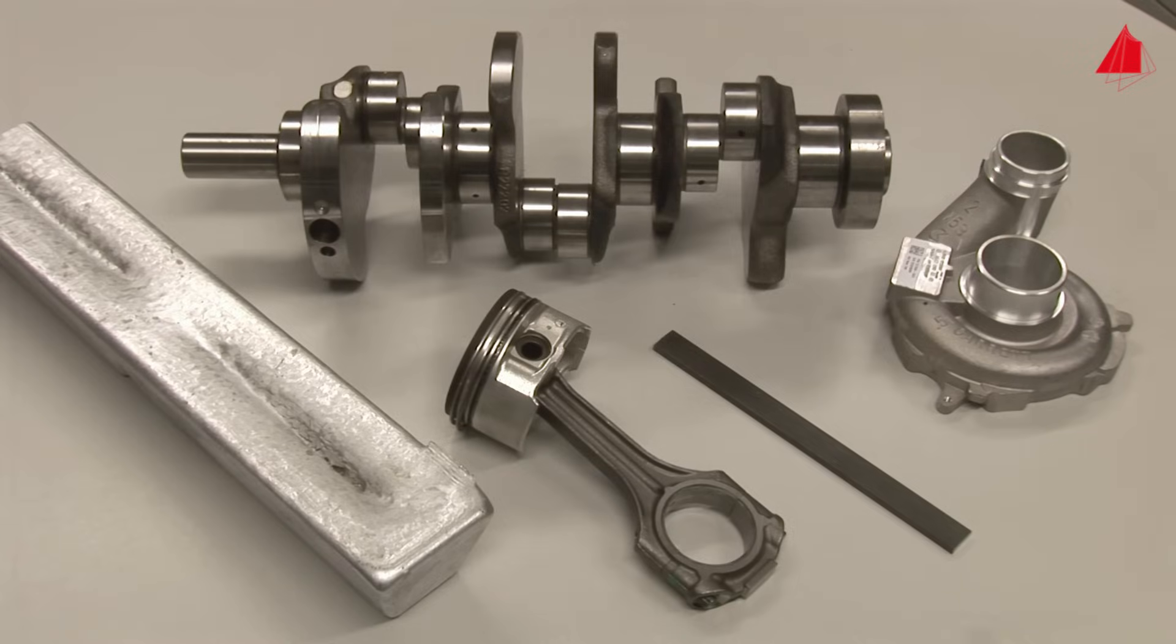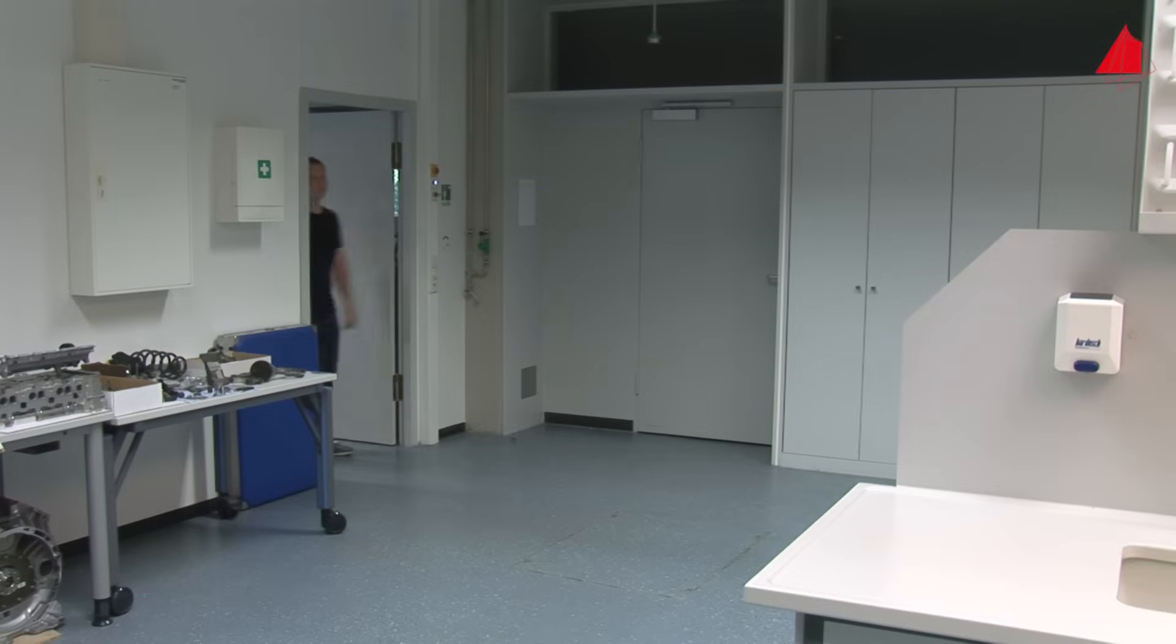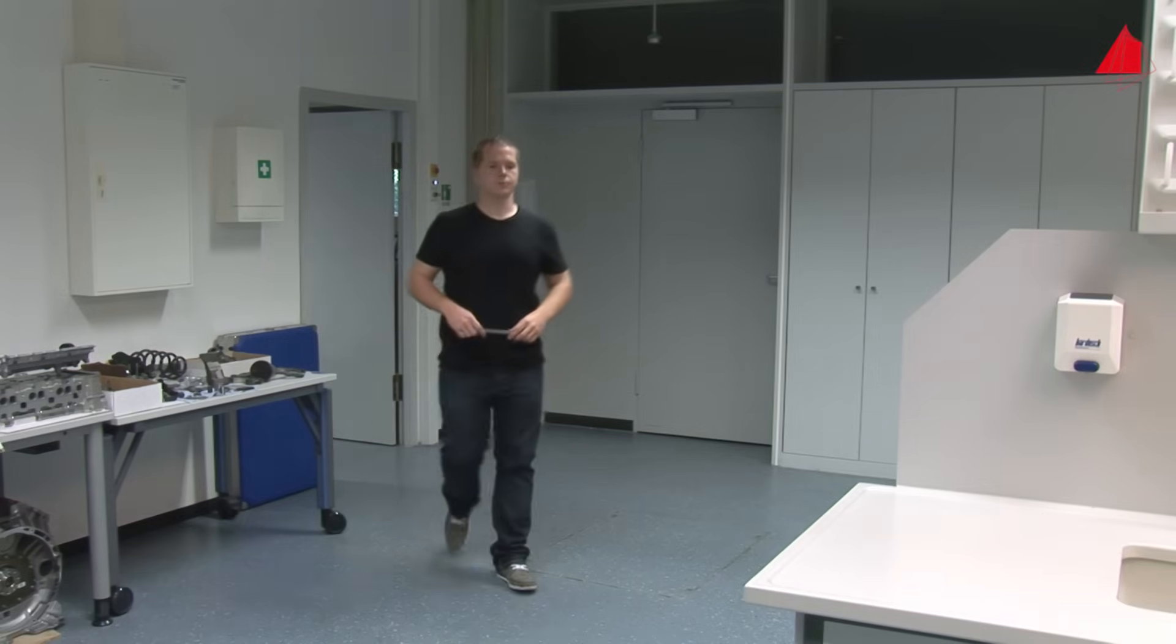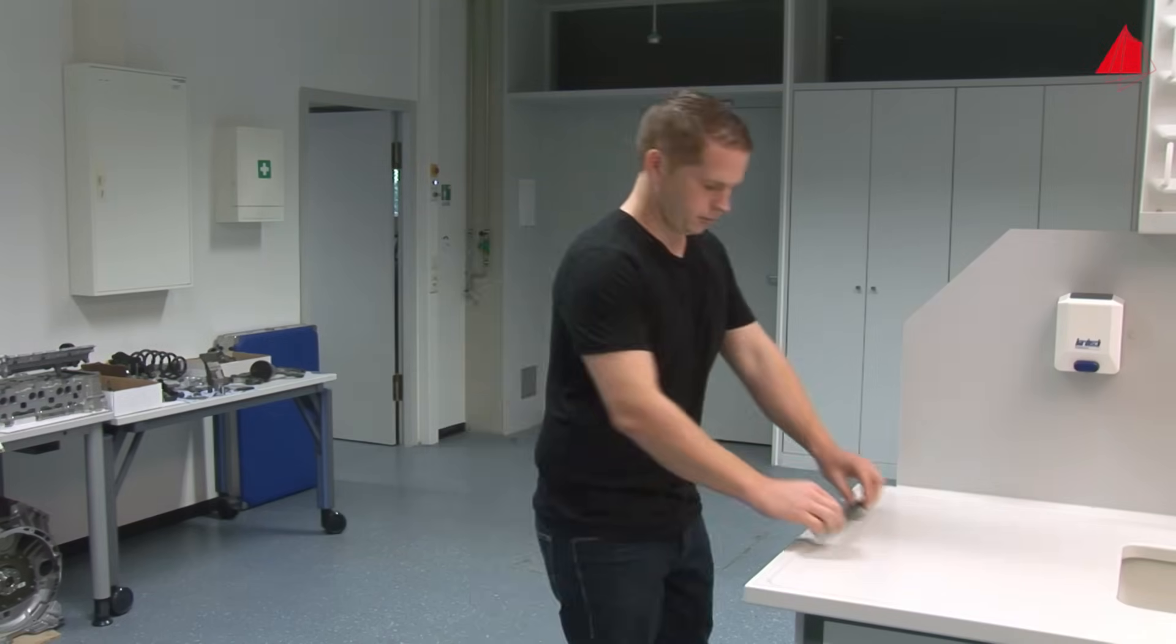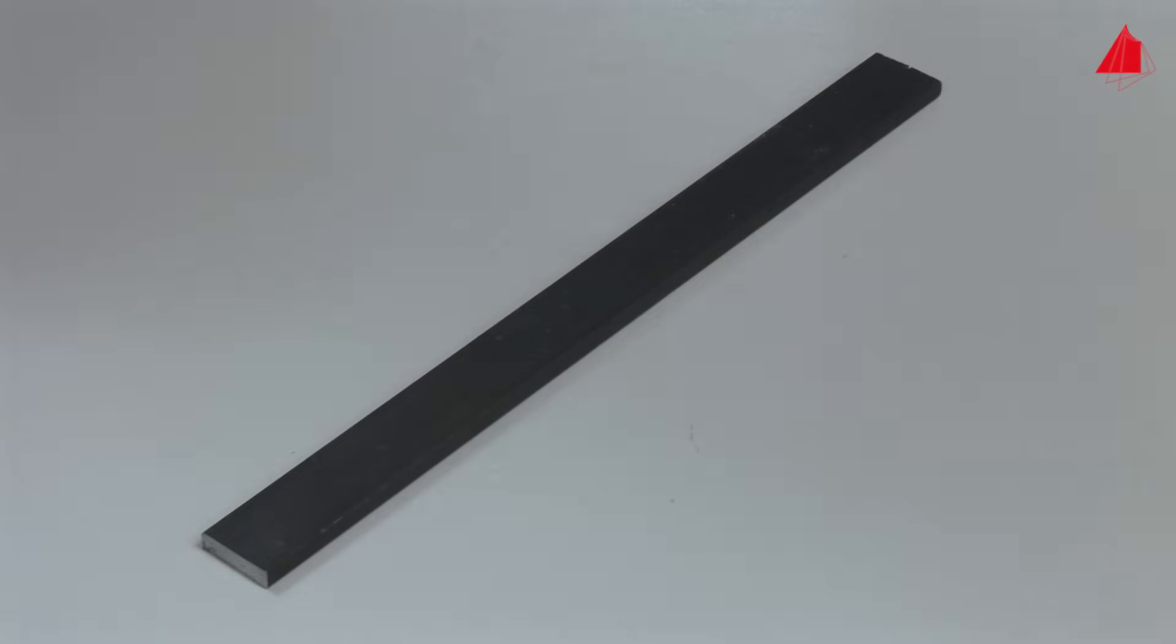As a typical example, we are going to investigate a bar made from a steel used millions of times, the plain carbon steel C45E with 0.45% of carbon. To start with, one of our material testers defines the intended sectional plane and marks it on the bar. In this case, it's a longitudinal section.